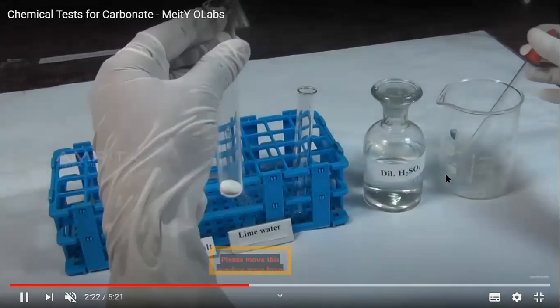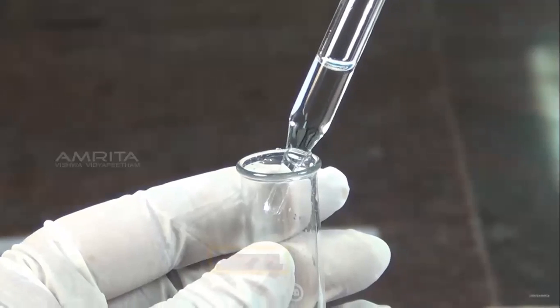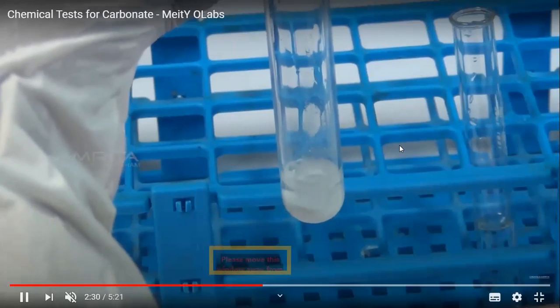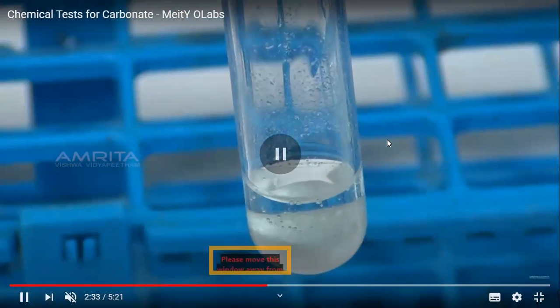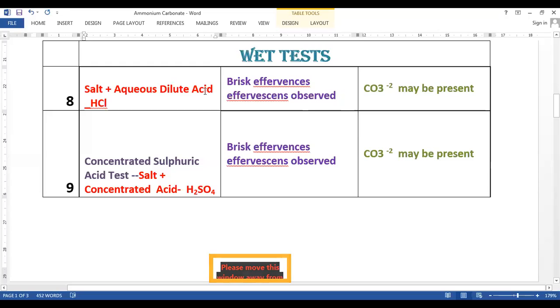We'll take the original salt in the test tube, and then we'll add the dilute sulfuric acid into it. When we add dilute sulfuric acid into it, we can see that there are bubbles formed, or effervescences, and these effervescences show us the presence of carbon dioxide gas, my dear students. So now let us note down the wet test. The first wet test is the salt plus aqueous dilute acid. Here in place of HCl, we can also use H2SO4.